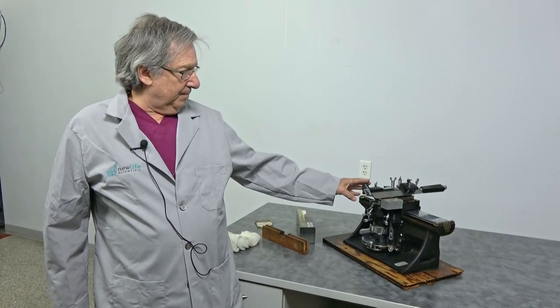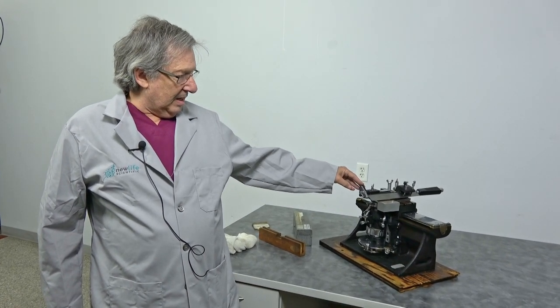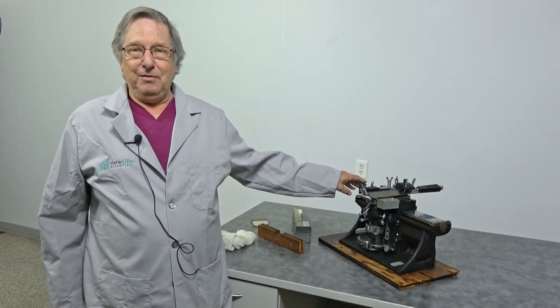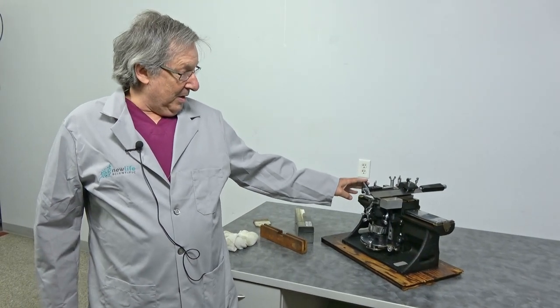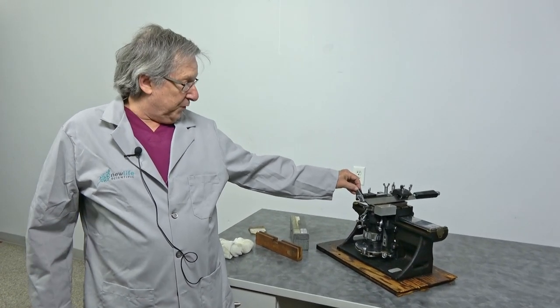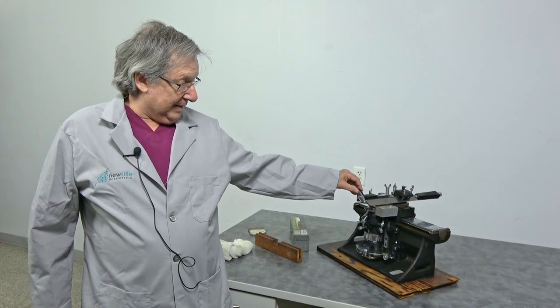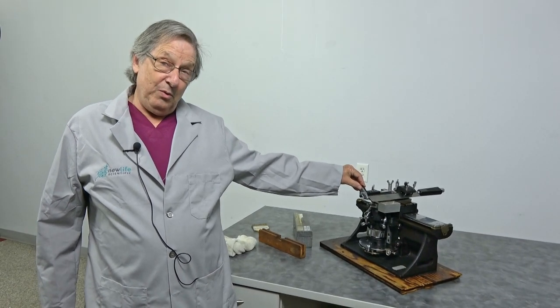This came in on some surplus equipment we got in. I'm a big fan of working on microtomes, so I couldn't resist. This unit needed a lot of attention, a few parts, but got the thing back together and actually working very well.